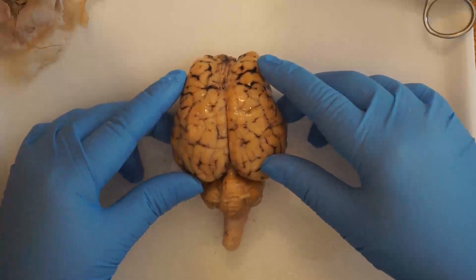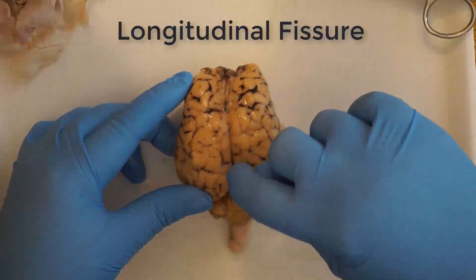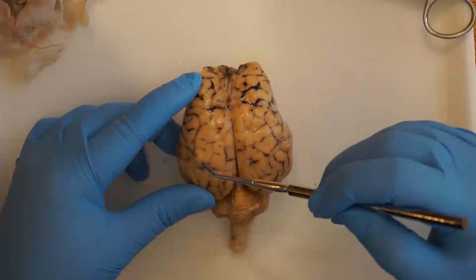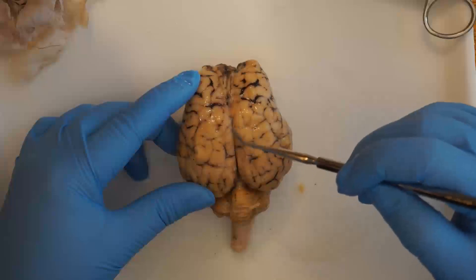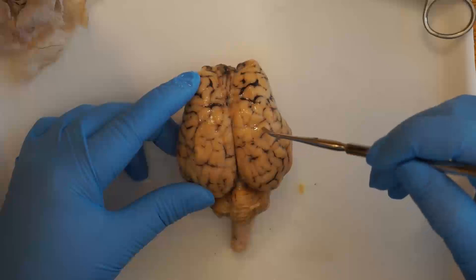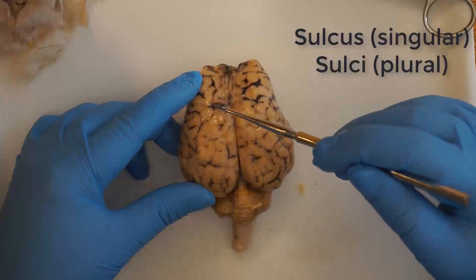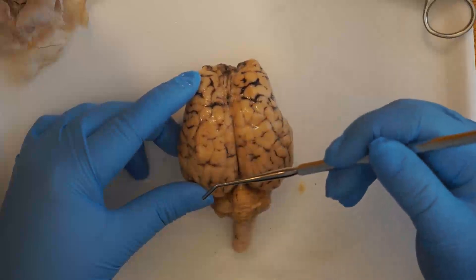Next you'll notice the long ridge down the middle of the cerebrum, and that is called the longitudinal fissure. Although it's the longest ridge, there are lots of little hills and valleys on the cerebrum. Each little hill or bump is called a gyrus, or gyri for plural, and the tiny little valleys in between are called sulci, or sulcus for singular.